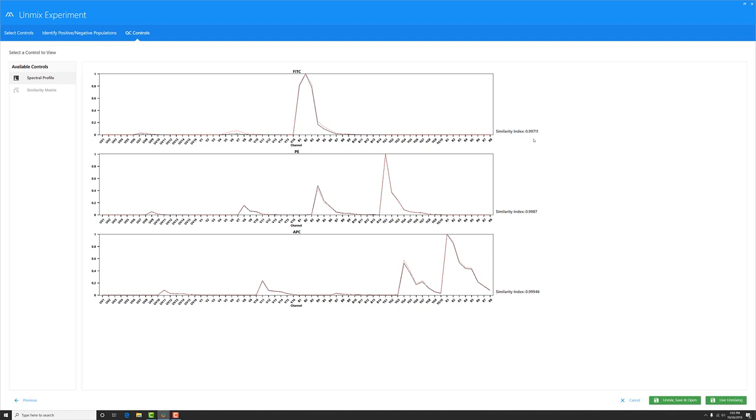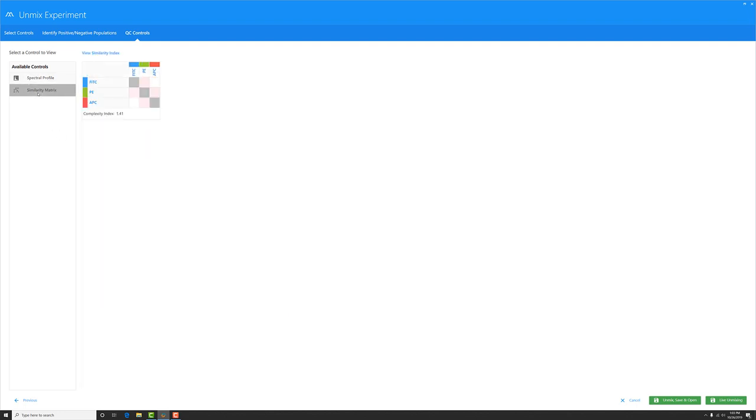If that number is close to 0, then those two dyes look nothing alike. So for these three controls, where I've run a FITC, a PE, and an APC, they compare quite well to the benchmarks I've stored in the system. The other tool that's provided is called a similarity matrix. It presents this picture here, where each dye is presented against the other to give you a color coding for its similarity, and you can view that by clicking View Similarity Index to see the actual numbers.